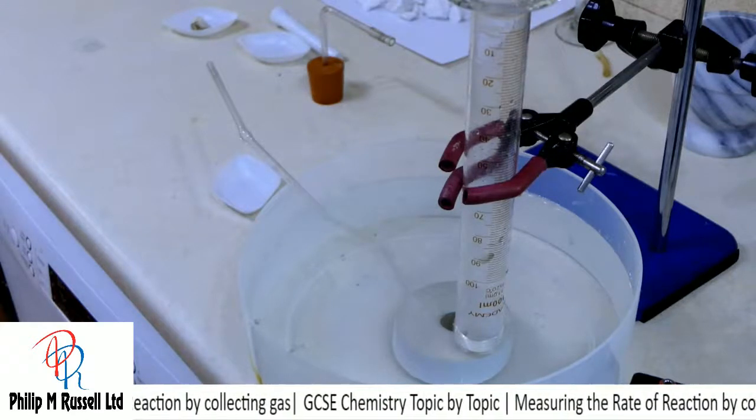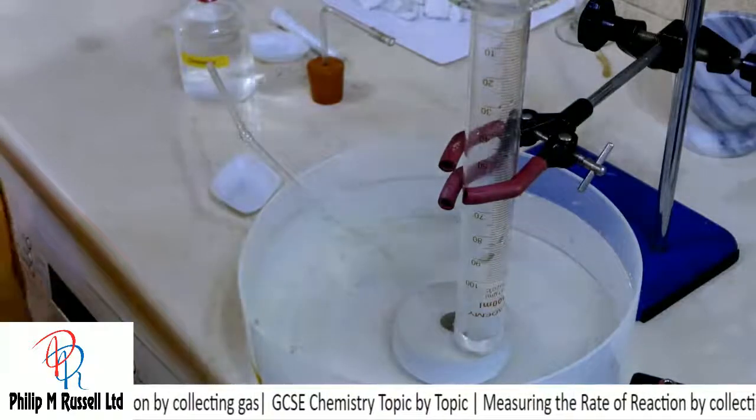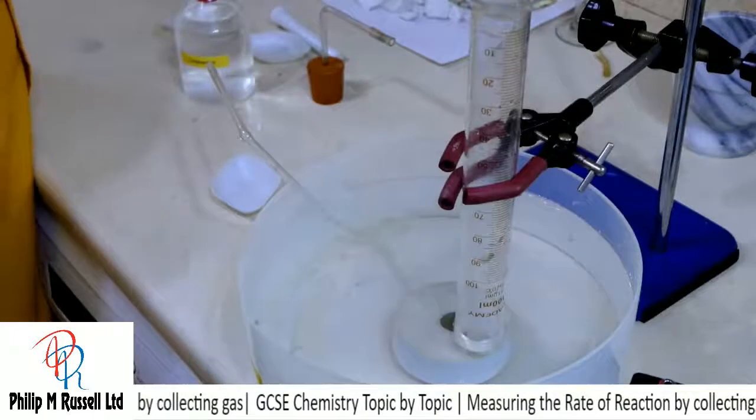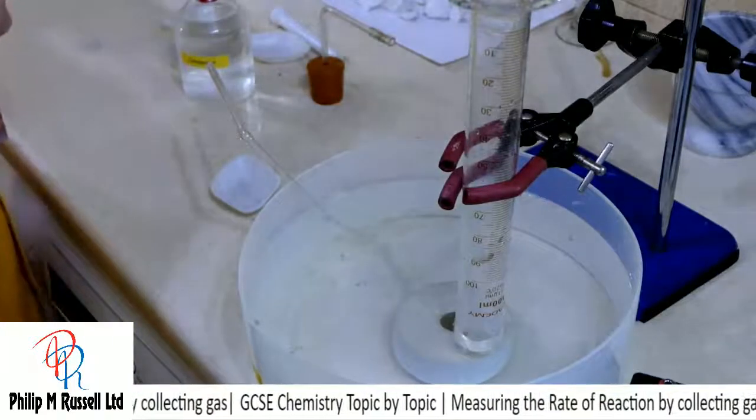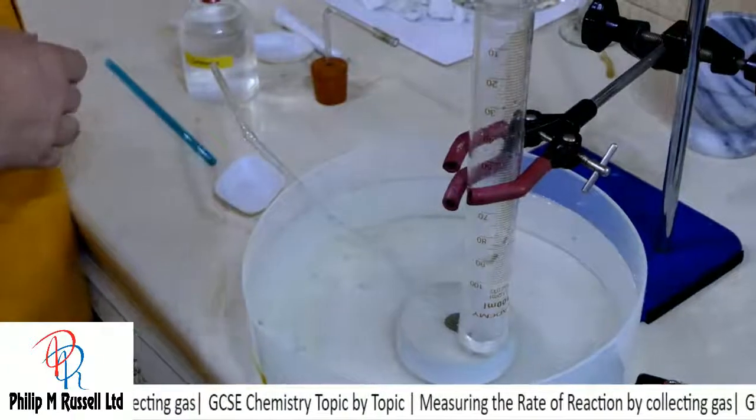I've got some lime water, and what I'm going to do is try this in a boiling tube. I've got my clean straw out.